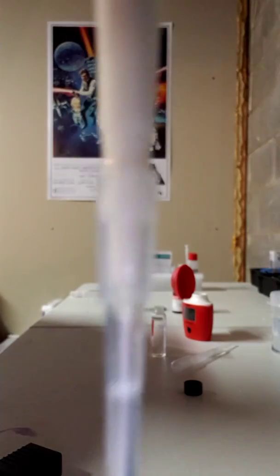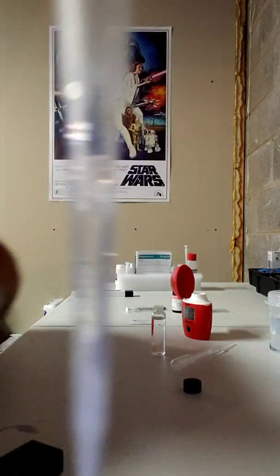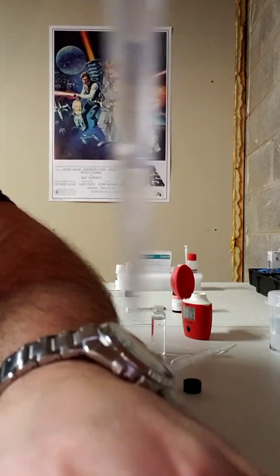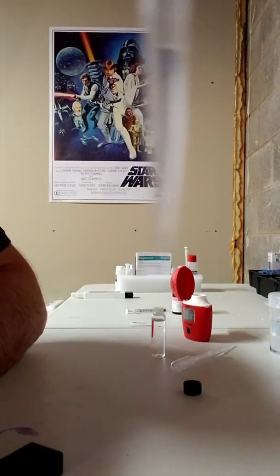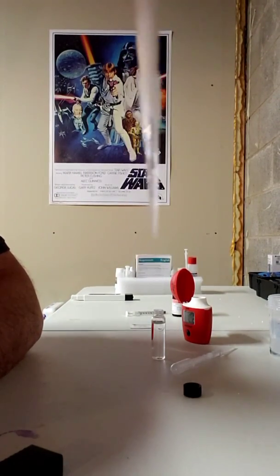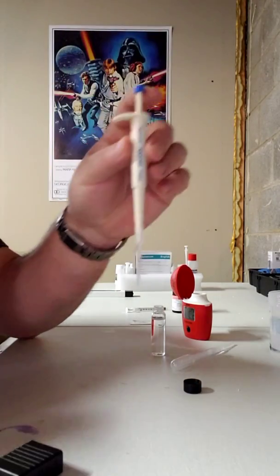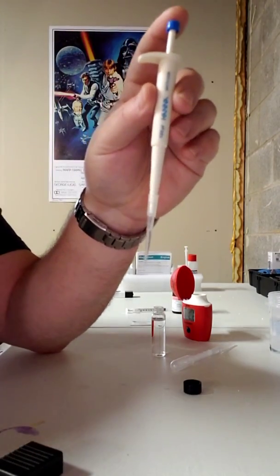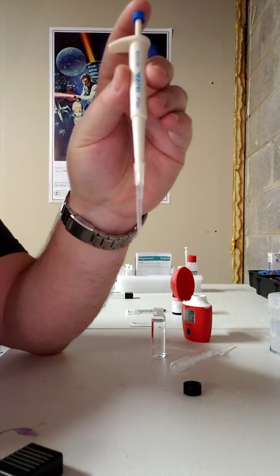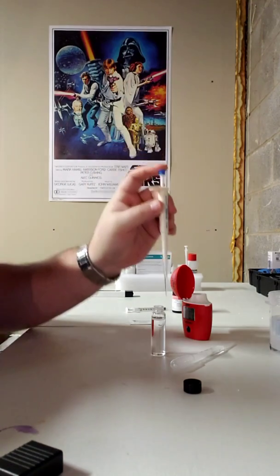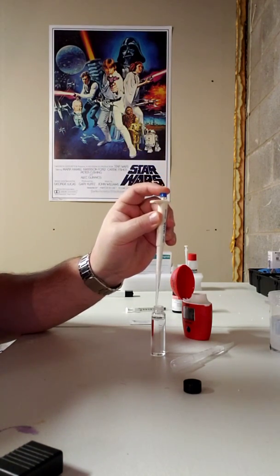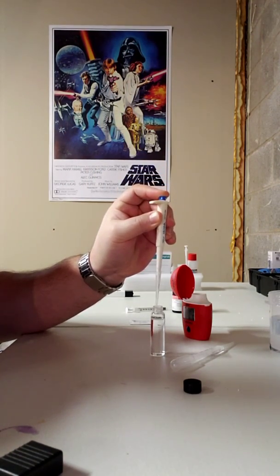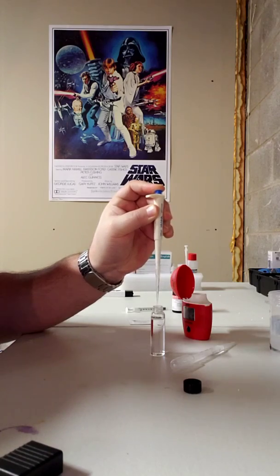Okay, so full of tank water, or at least to the little line. Okay, so we have our tank water. I'm going to add that. Remember to press down all the way.